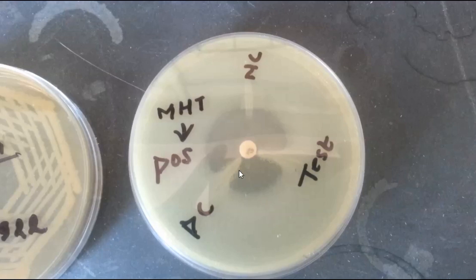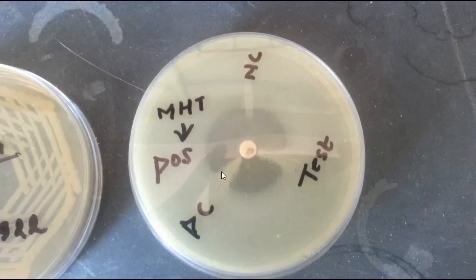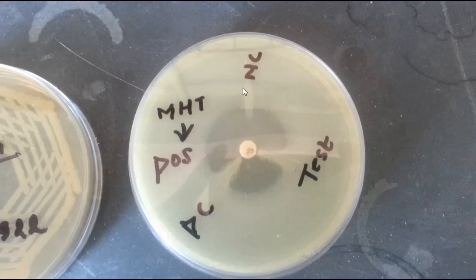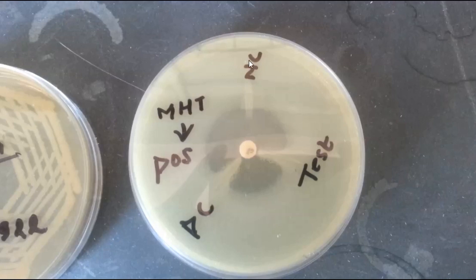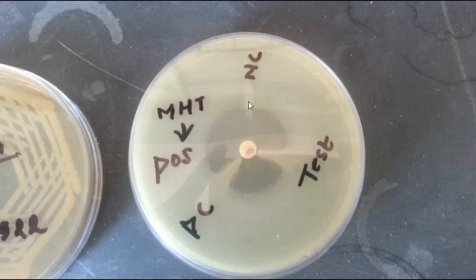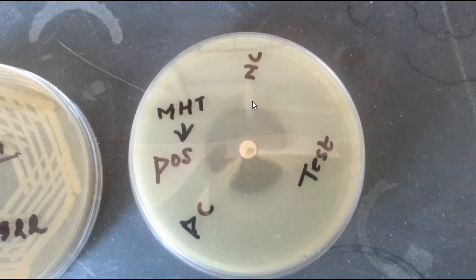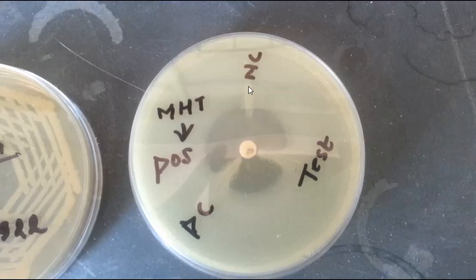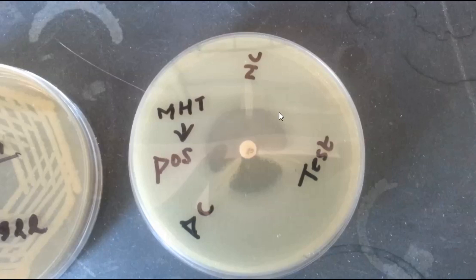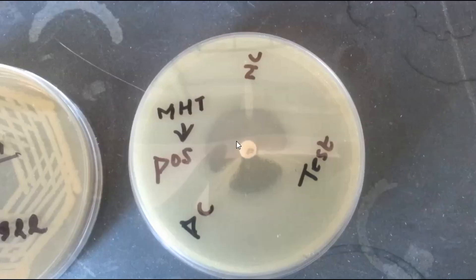Similarly, you can see the same positive result in positive control two, but this is lacking in the negative control — that is, there is no growth of E. coli along the test organism growth streak within the disk diffusion zone.